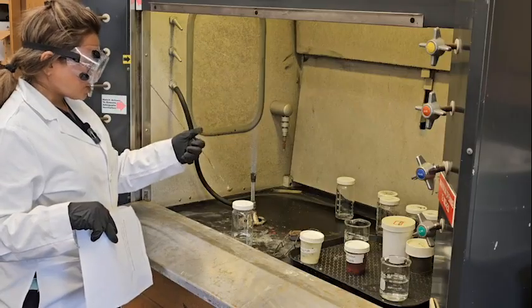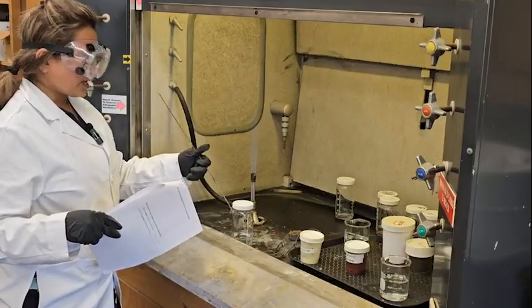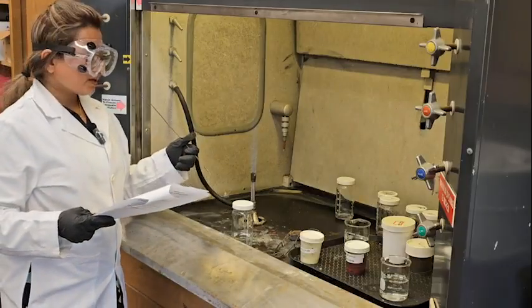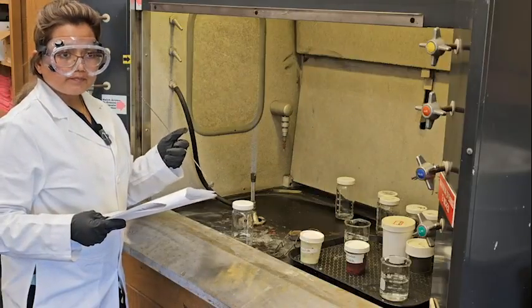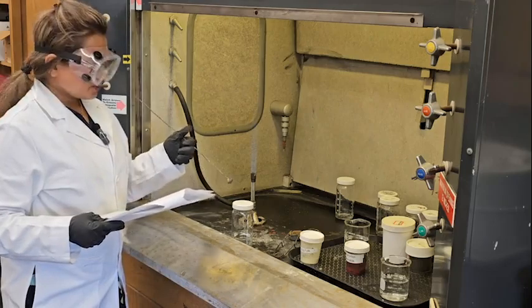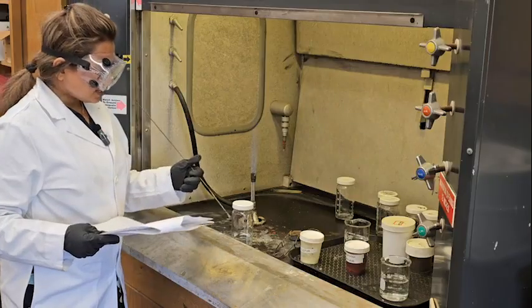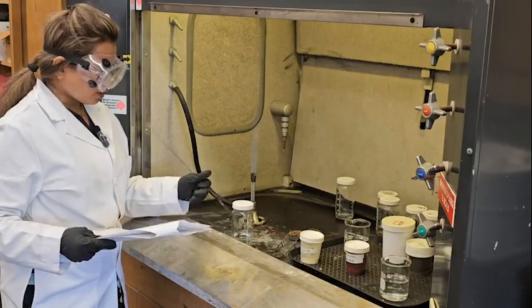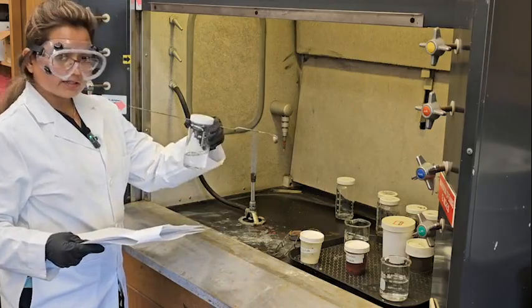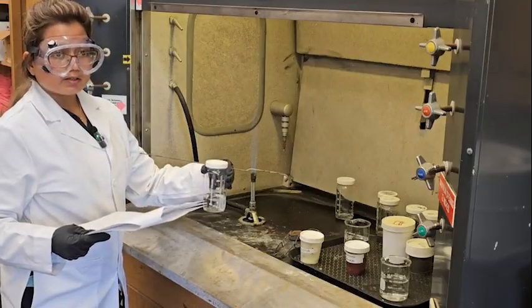We are going to check the color changes, and also part 3 is actually preparing for part 4, which is the pH test. So making the oxide for each element, we let it stay in contact with the water we have inside, because for the pH test we need some water.